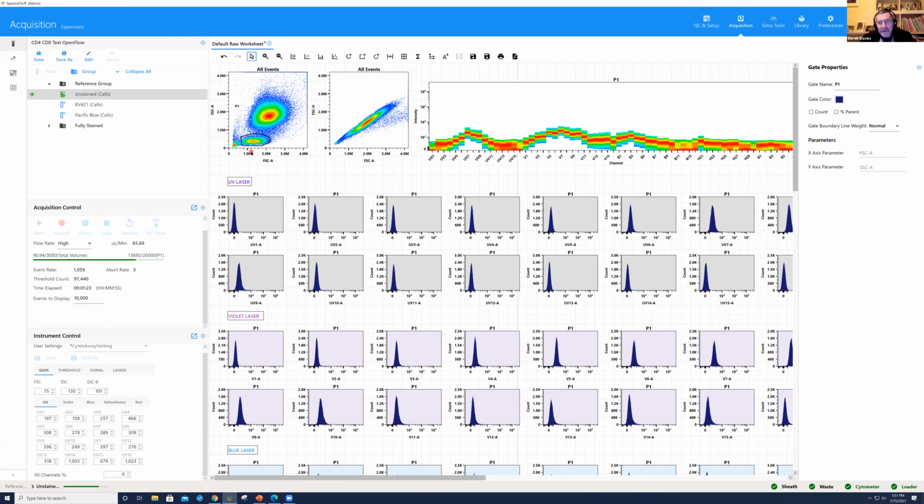Is there a minimum number for that? So when we're talking about positives, if you're talking about a positive population for, say, BV421 or PAC blue, my aim is at the very least 1,000. For unstained, I don't know the specific number that Cytek defines for the SpectroFlo software. So if anyone's online that has that number... but if you have 10,000, it works, that's perfectly fine. 5,000, it works. I typically like to have 20,000 unstained, but also remember that for your unstained sample, if you're comparing that and using it for gating, you want a nice robust population. So I would say more isn't a bad thing, and it's always better.